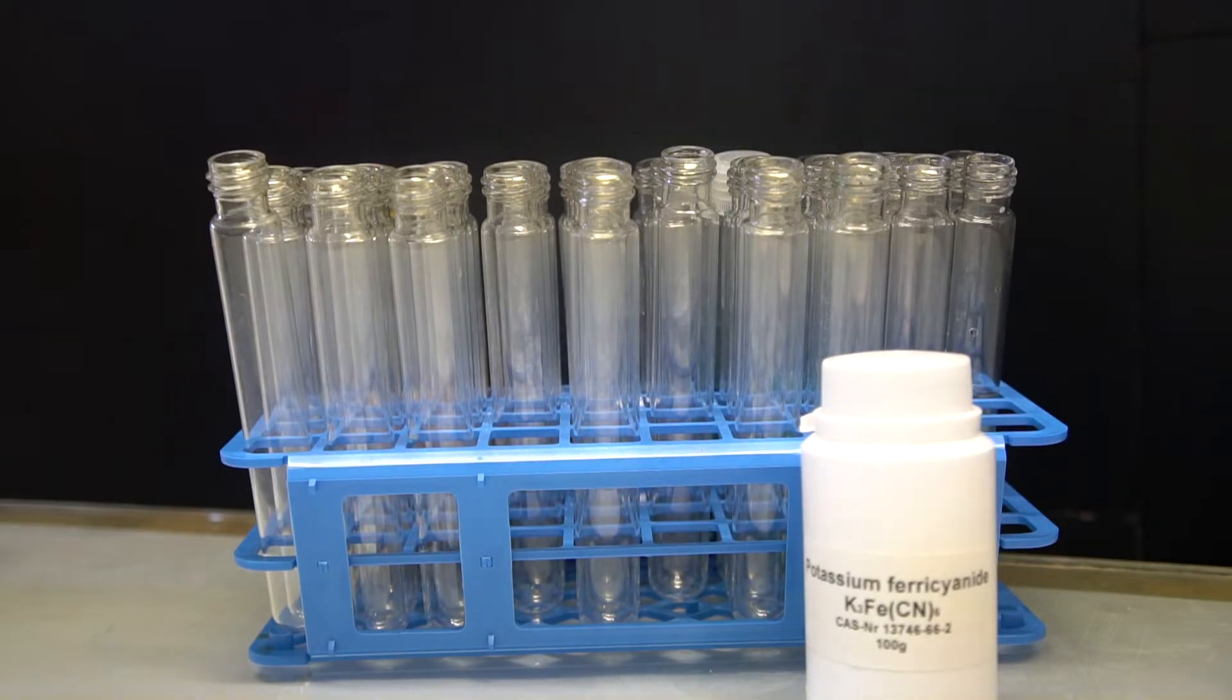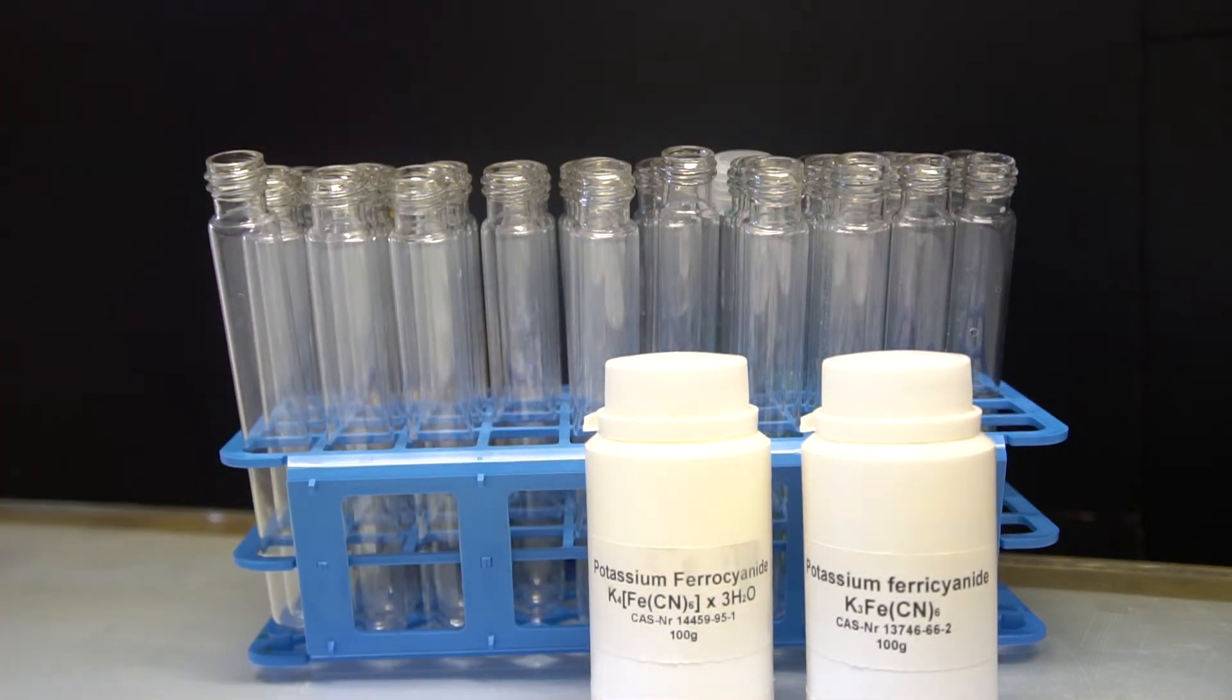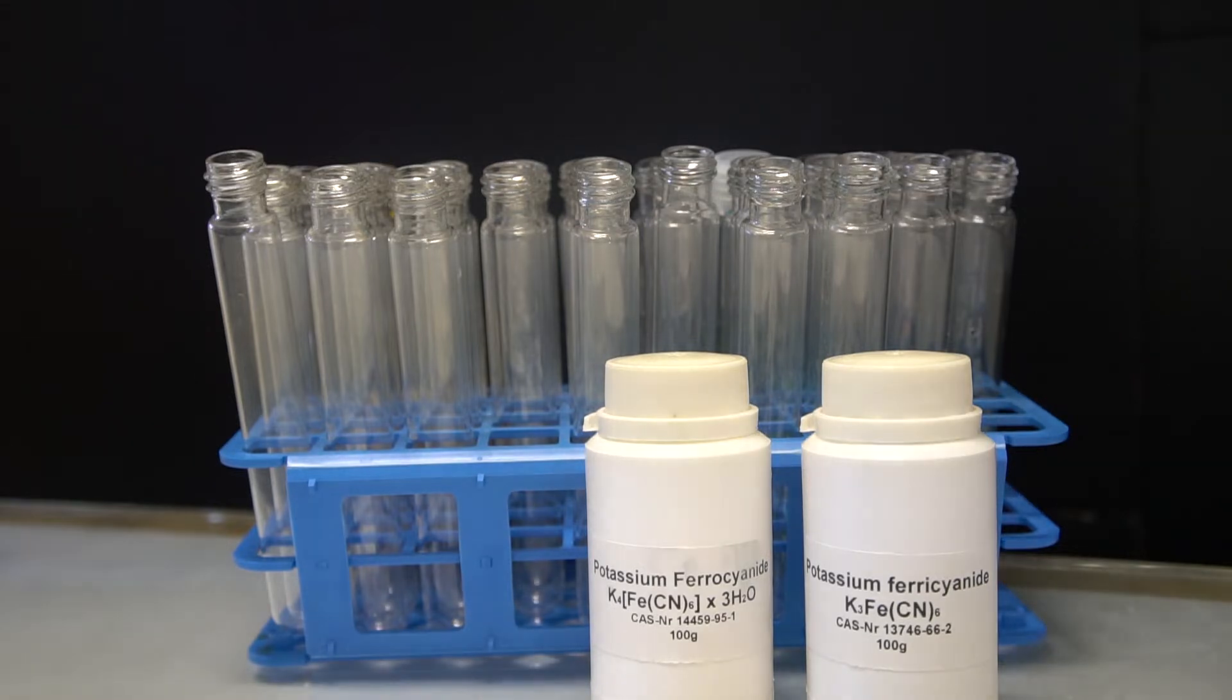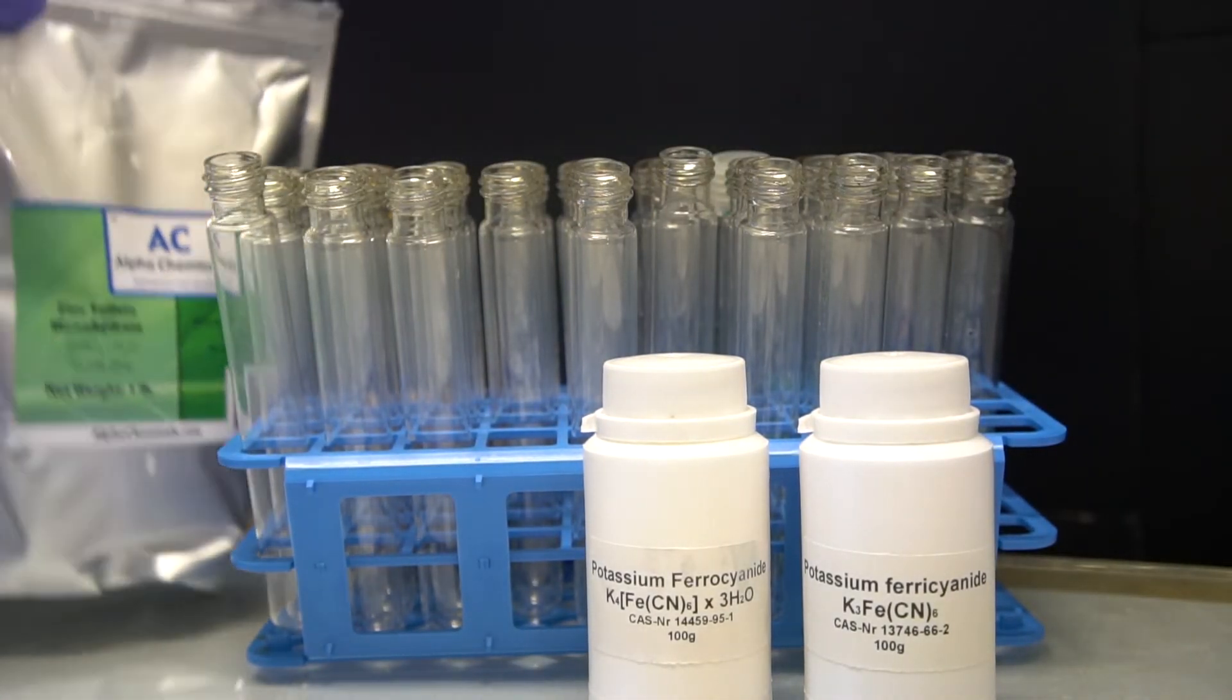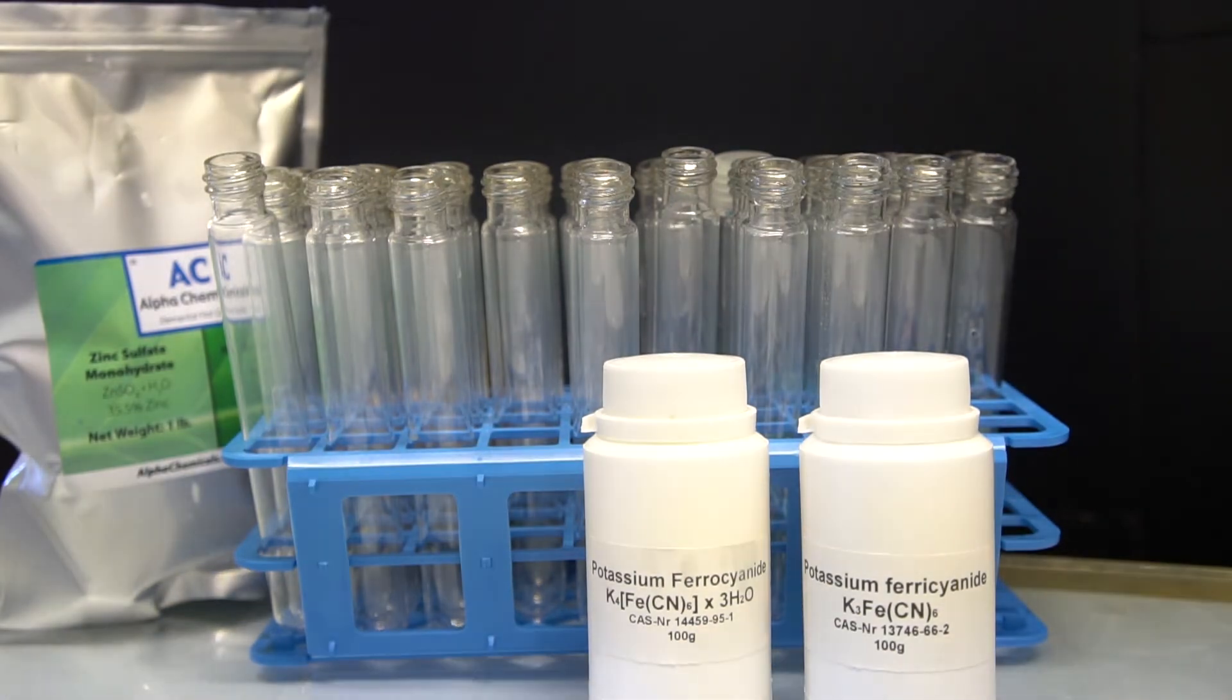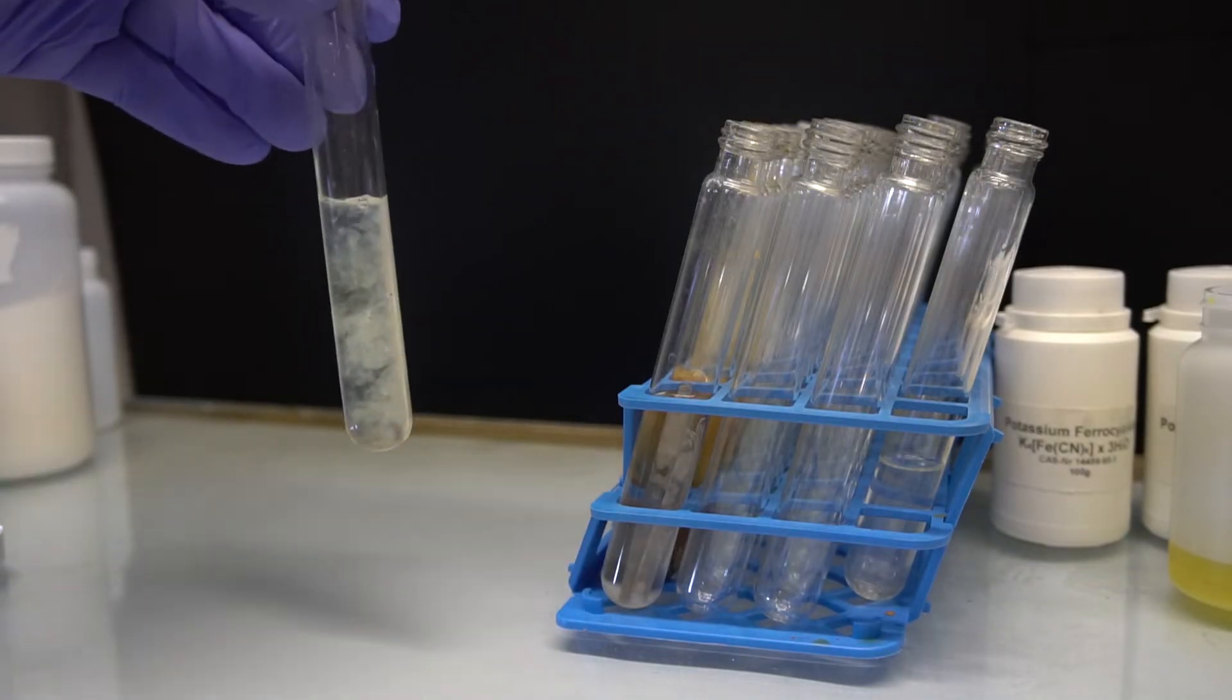But can we do further tests to be more certain? It was time to test with the cyanide complexes. First, we did some reference tests. We reacted both potassium ferrocyanide and potassium ferricyanide with zinc sulfate, and noted the products.